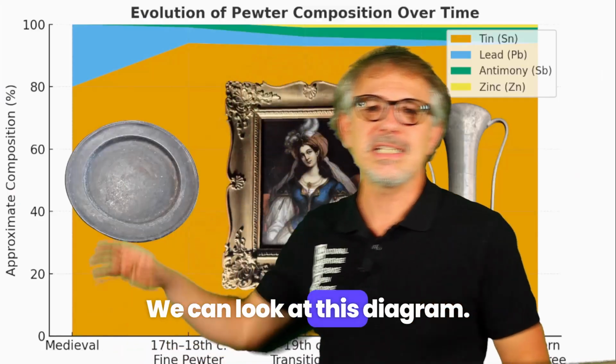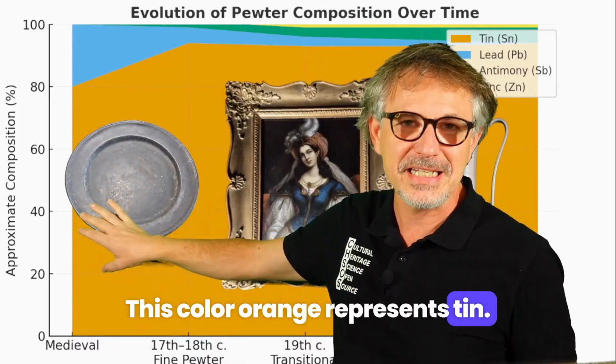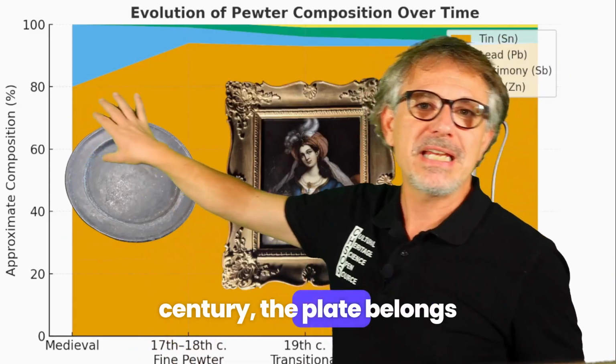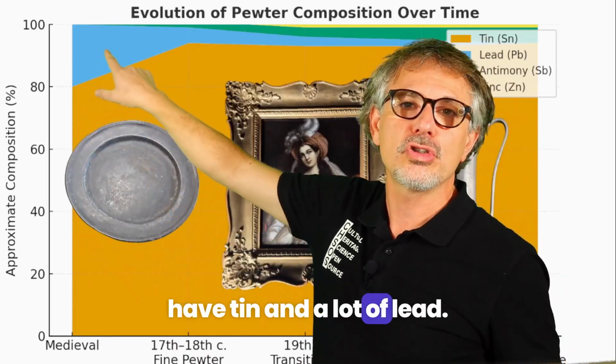We can look at this diagram. This color orange represents tin. So here we have a time frame, from medieval till the 17th century. The plate belongs to this area, an area where we have tin and a lot of lead.